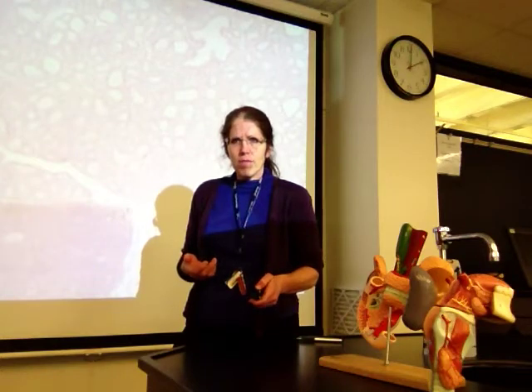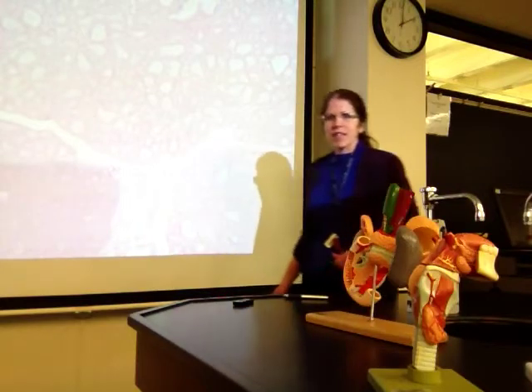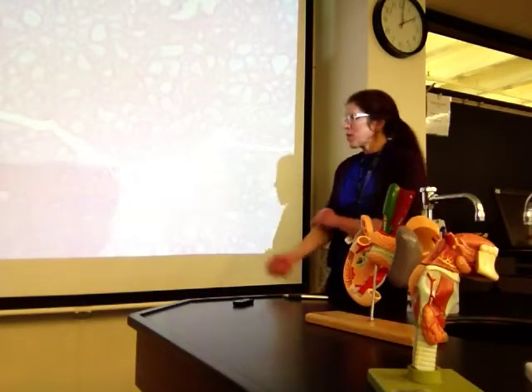Oh, there we go. For some reason now we just tilted just right and I can see, no, don't move any further. And I can see the slide a little better. All right, which is cool.